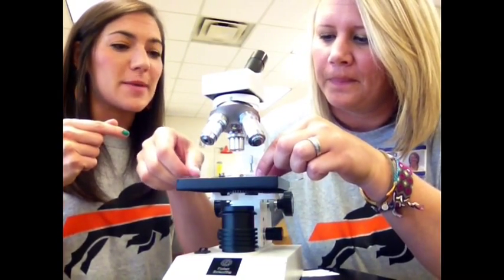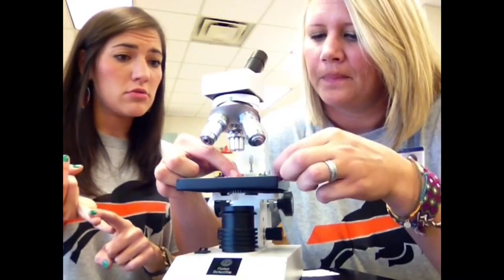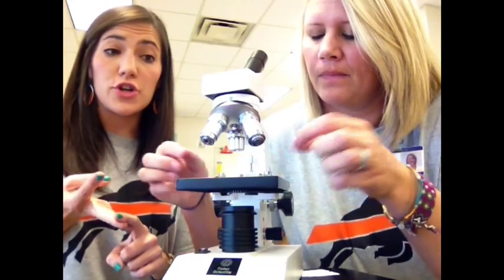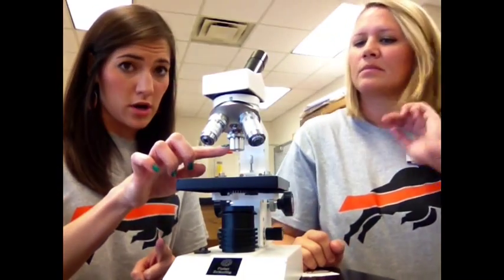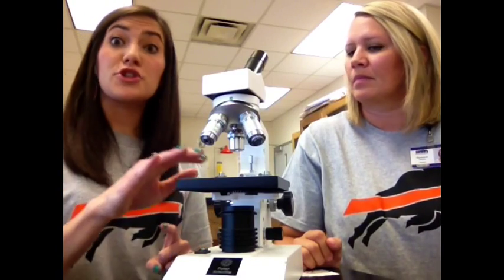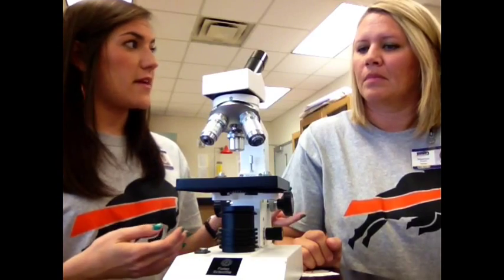So step 1, turn it on. Step 2, move the stage down. Step 3, make sure you're on the lowest objective. It should have a 4 on it. Step 4, put your slide in place. So Coach Fears has now done that.